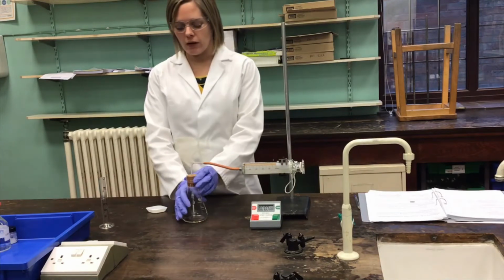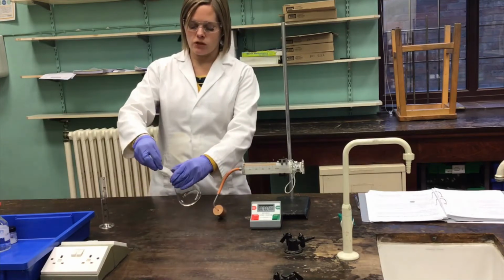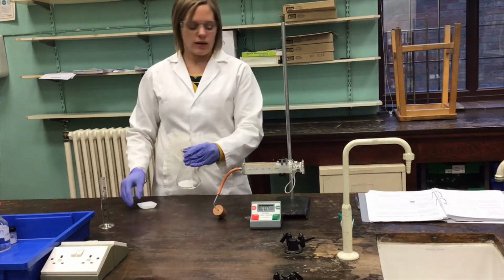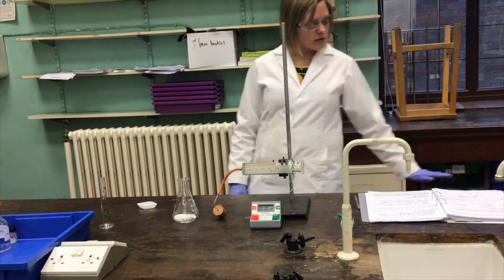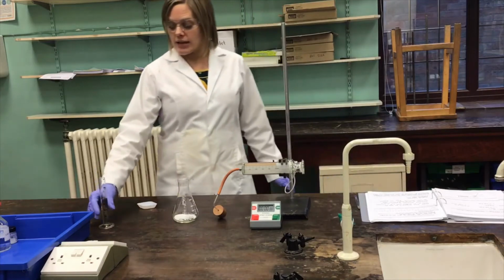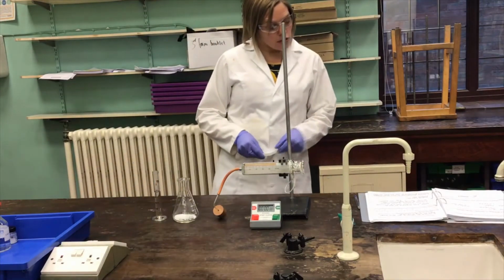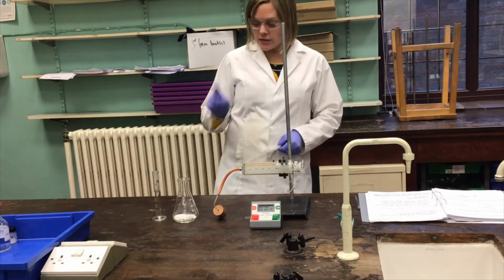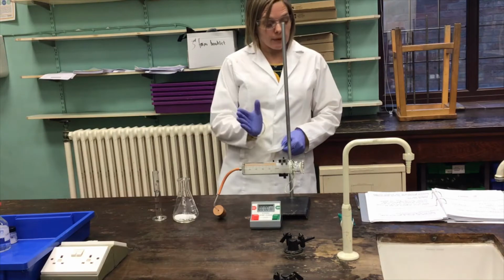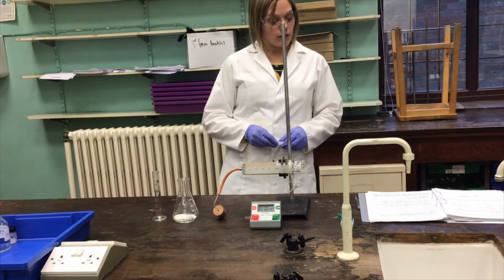What we've got here then in the conical flask is, sorry, 10 grams of small marble chips going into that conical flask like so. In a moment then I'm going to add to that 20 centimetres cubed of 0.5 molar hydrochloric acid to the flask. Replace the bung really quickly and watch what happens to that volume of carbon dioxide over a course of time, so over about 3 minutes.